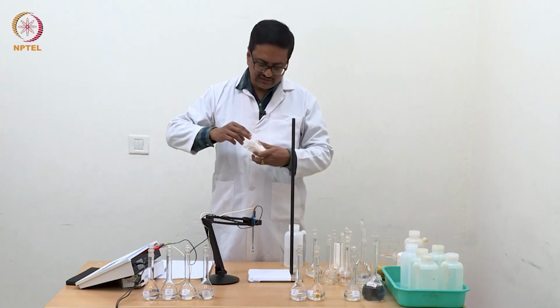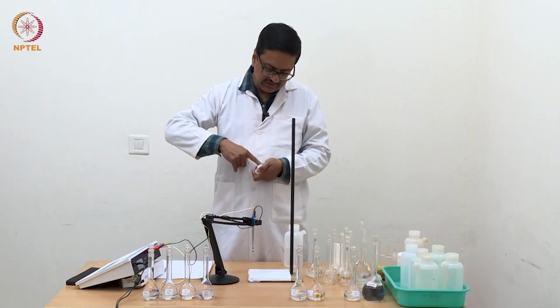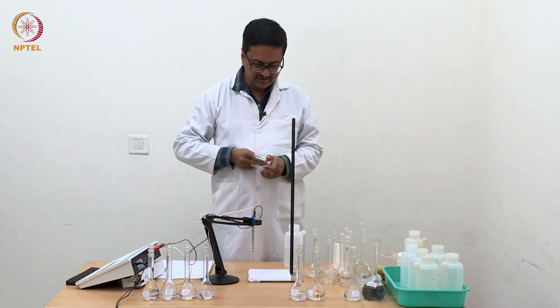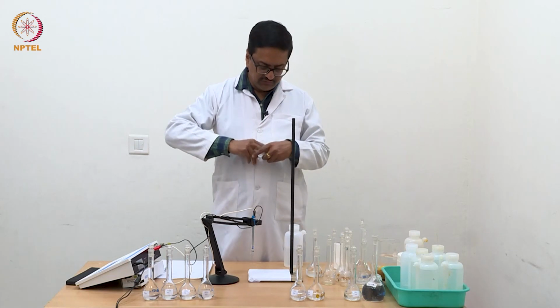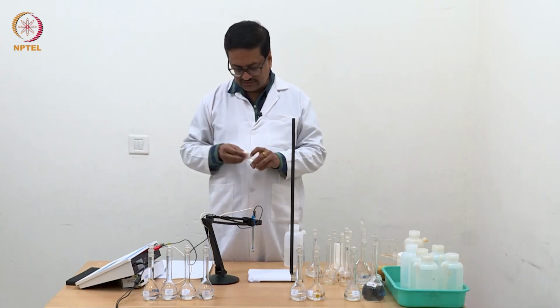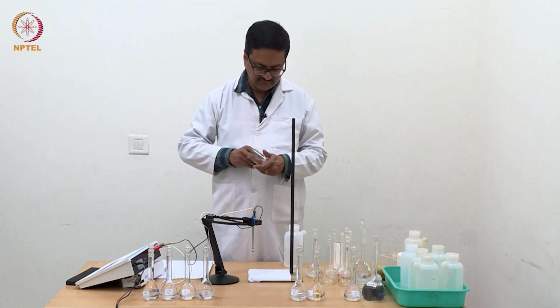As I am now reaching higher concentration, this cleaning has to be done very carefully so that no drop of a previous concentrated solution stays here, because every drop of that solution may result in a change in the conductance in terms of 1 or 2 millisiemens.